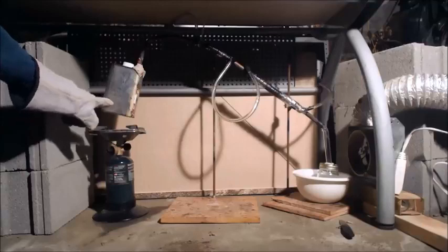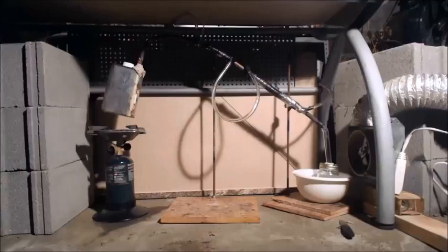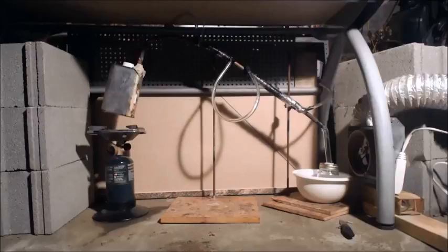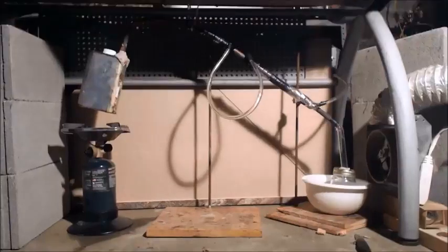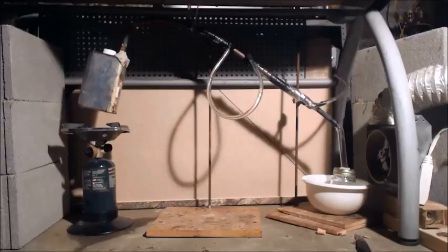So basically, I have 104 grams of polystyrene. 104 grams of styrene is a mole, so that's like a mole in there. Probably going to get a lot of polymers coming over with it because I'm heating it so high. I guess I should call those oligomers instead of polymers. Oligomers, I think, are up to 9 or 10 monomers in the oligomer. Once you get above 10, I think it's then called a polymer. You know, dimer, trimer, oligomer, and then polymer.